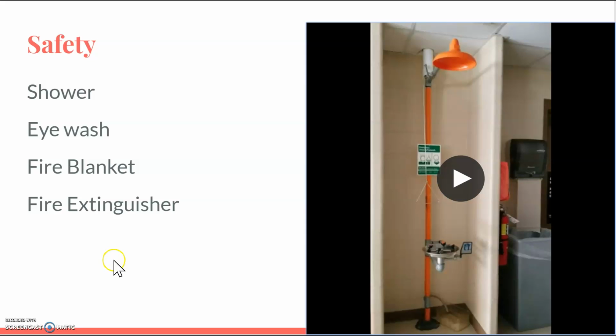All of these safety devices are together in this one area on the wall. So when we get there on Tuesday, make sure before you do anything, you check so you know exactly where the safety items are, where the safety shower is. The eye wash is right underneath, and right next to it is a fire extinguisher and the fire blanket. So we all want to always stay safe in class.